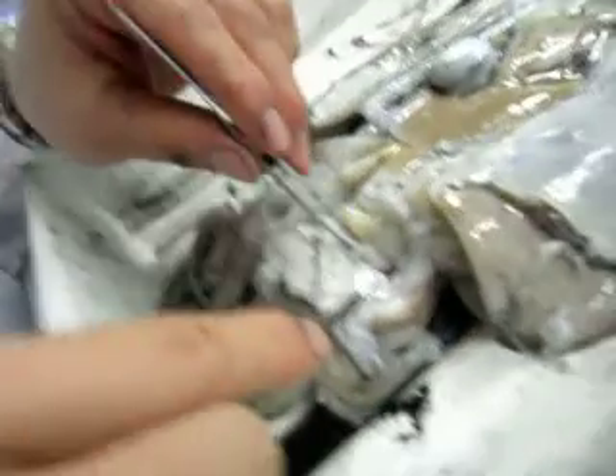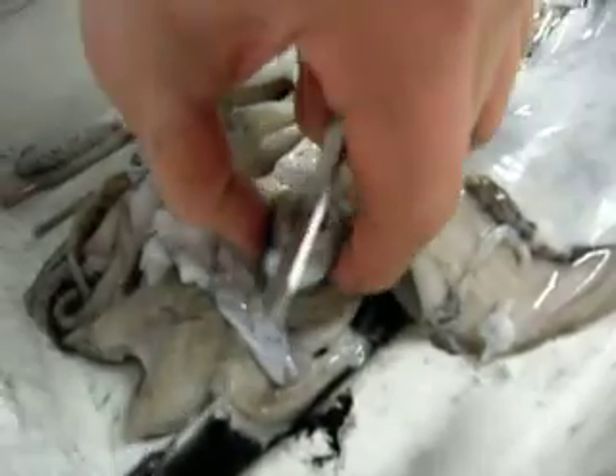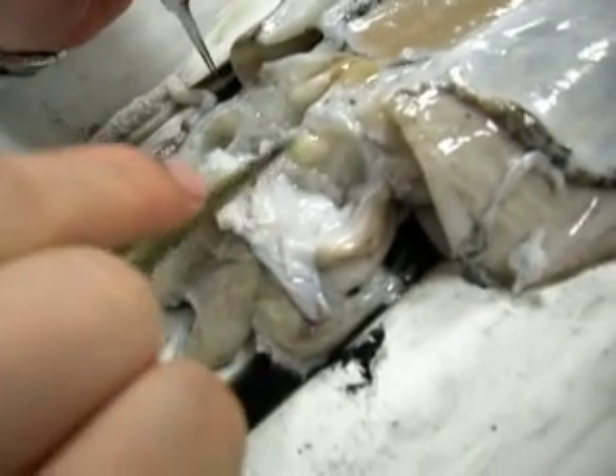I have to note, here's the eye, which I've just removed. It's quite interesting to see that there's a cartilage socket that keeps the eye inside, and there's more brain in here.